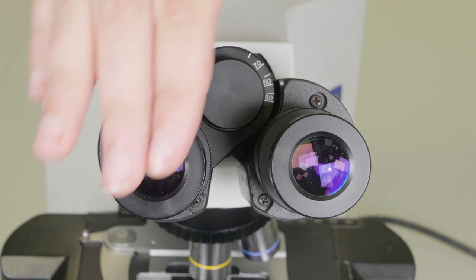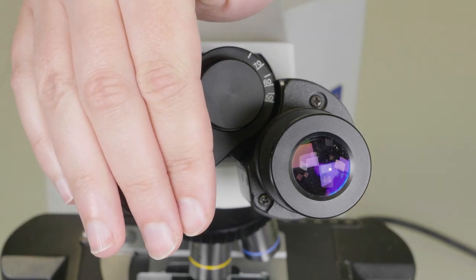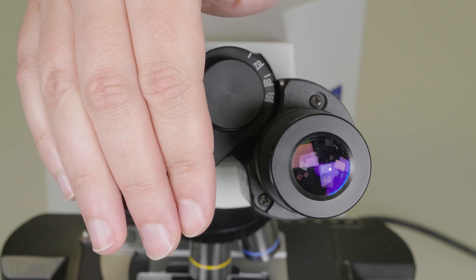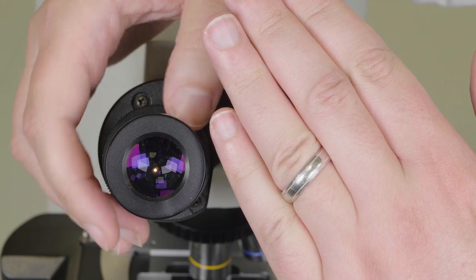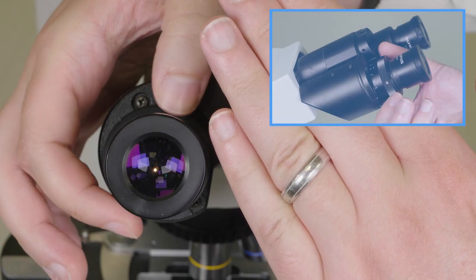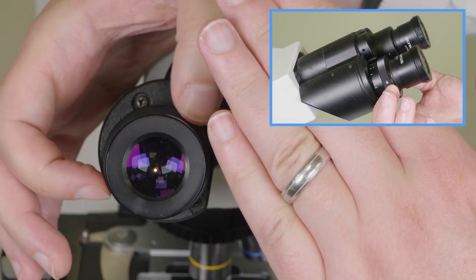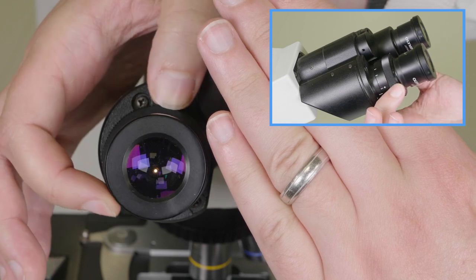Next, cover your left eye and looking down the microscope, adjust the stage height until the image is in a sharp focus. Then shut your right eye and use the focus controller on the left eyepiece to bring the image into a fine focus for your left eye.